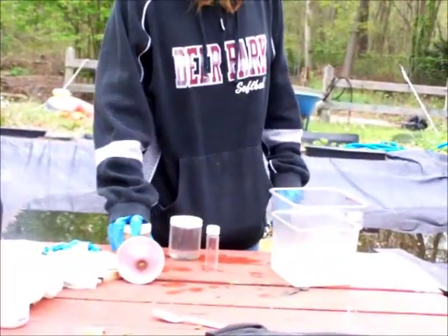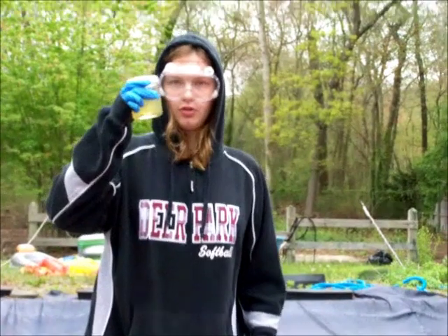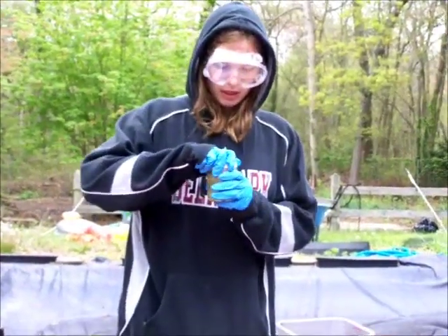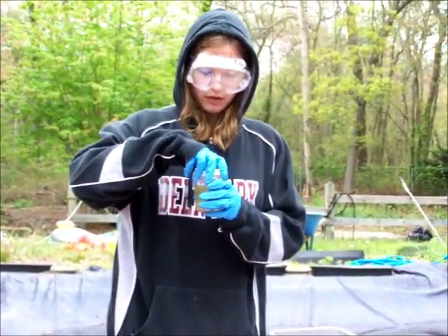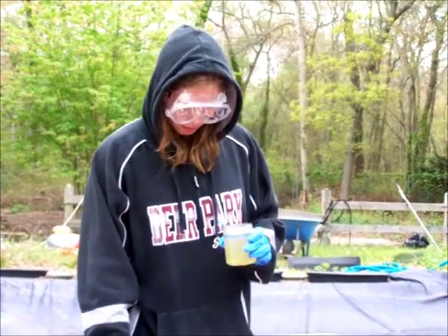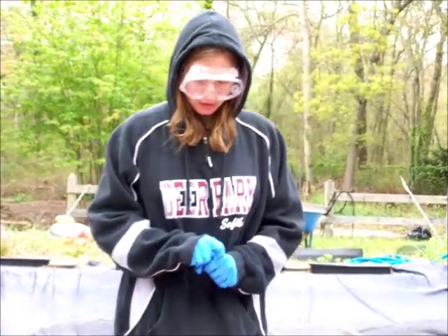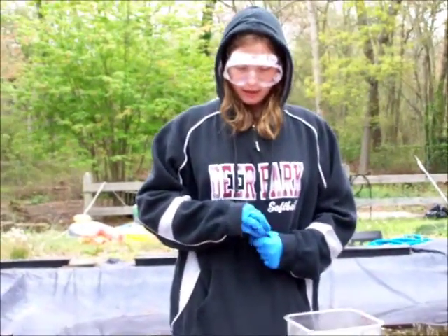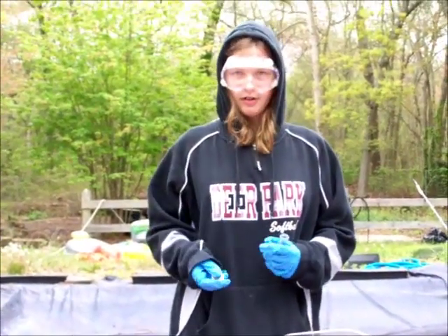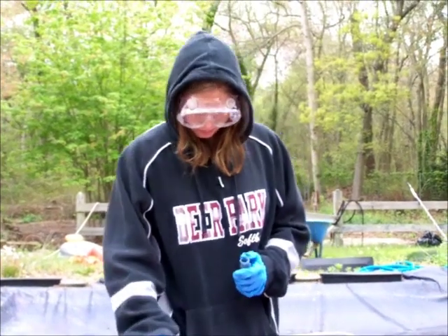Right now I'm going to take my iron sulfate aqueous solution, in which I dissolved iron sulfate into water. What's happened here is it disassociated so that it produced iron, Fe plus 2, and sulfate separately.